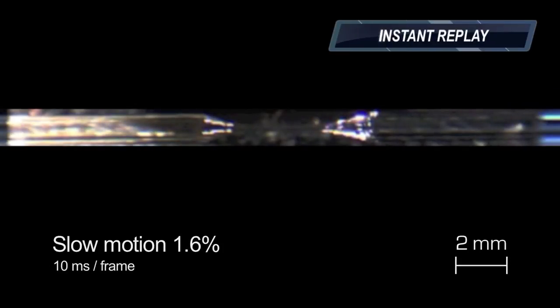In the second pull, the pipettes are separated after only a short flashing glow in the center of the hourglass. Here is a shot of another pull with the same parameters in brighter illumination. The frame rate is 100Hz this time.